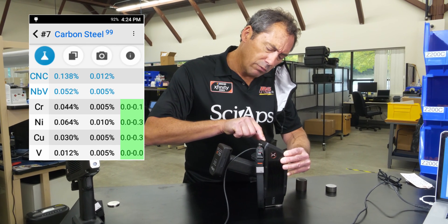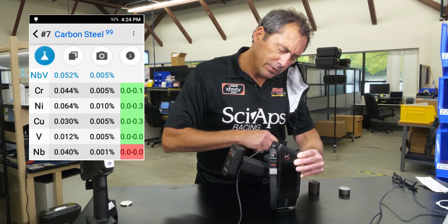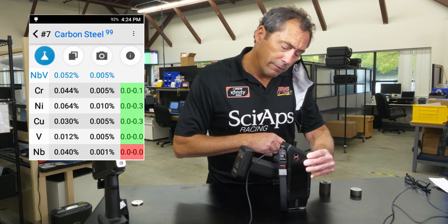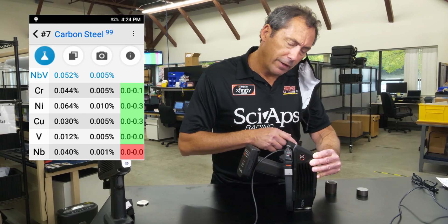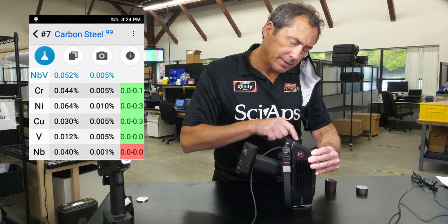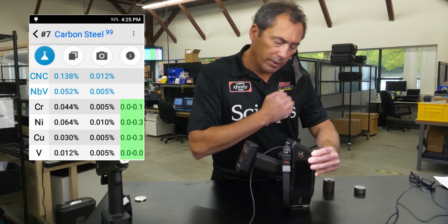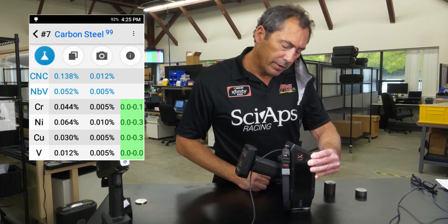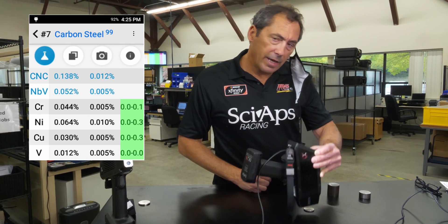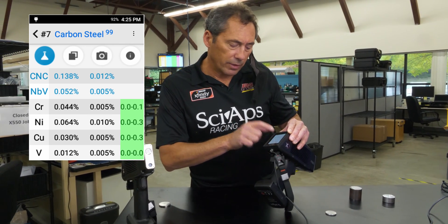Vanadium is nice and low, down around 0.012. But niobium in the sample is high — it's about 0.04. So that would fail on the niobium and vanadium, but it would pass on the copper, chrome, nickel, whatever your requirement is. And that is how you do residuals.